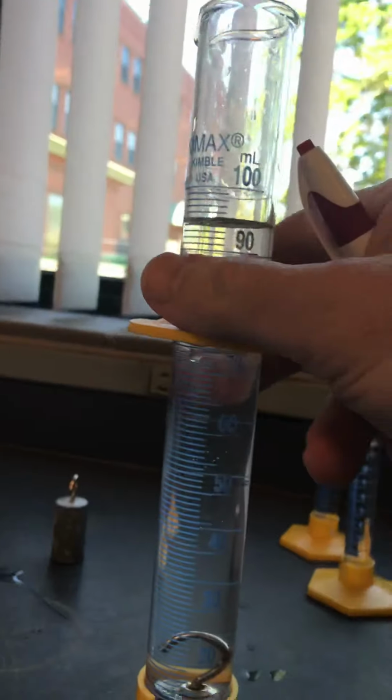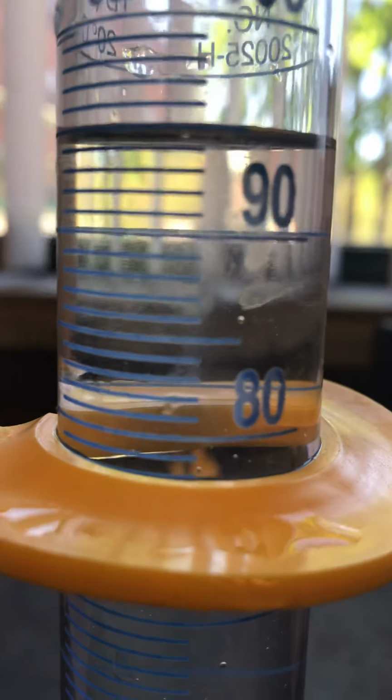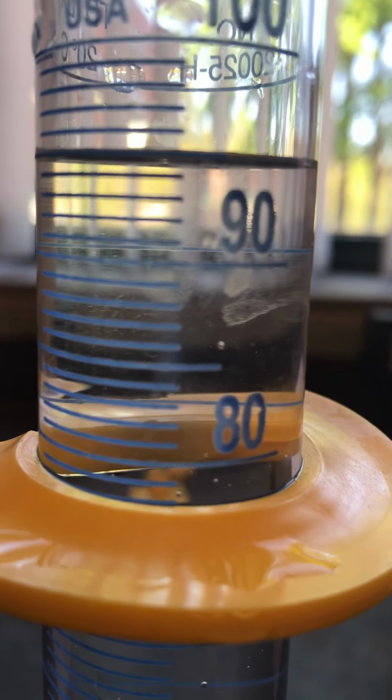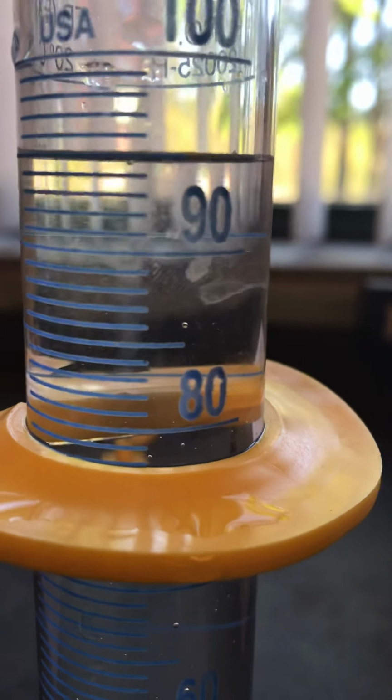We are back. Okay, this is the second one I did. I did the zinc first. The second one I did was the lead. You can see the piece of lead at the bottom there. We've got the water up here. And I try to be very, very accurate with these graduated cylinders here. I was being accurate to the 100th place. That's 91, 2, 3, 4. And I got to get this at the right angle, called parallax.